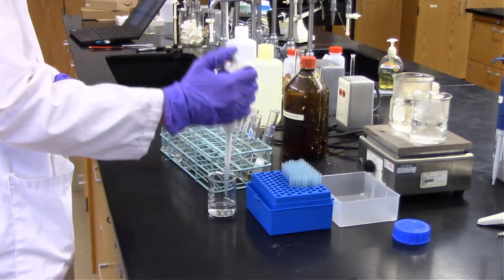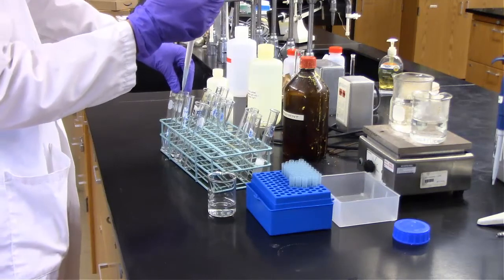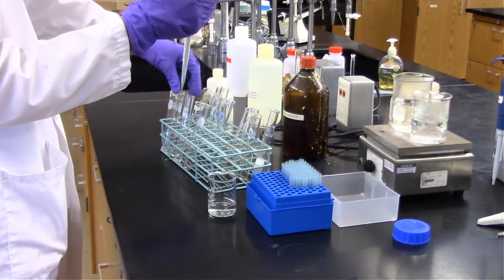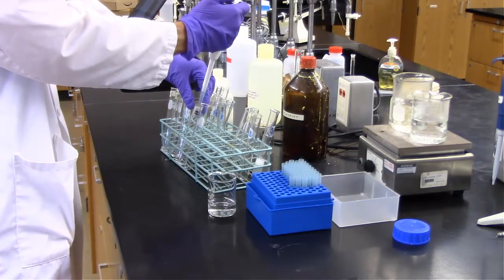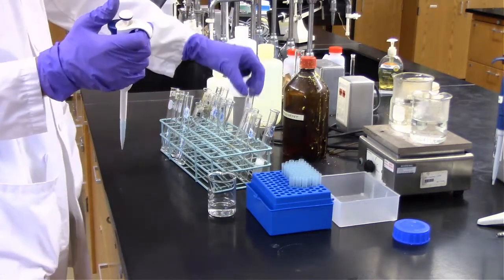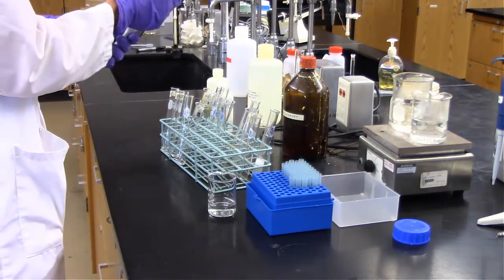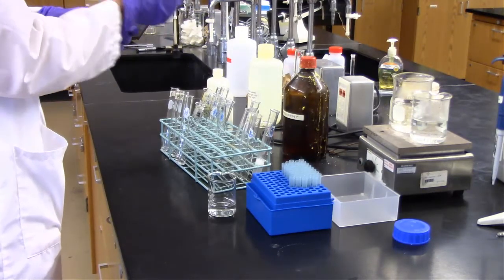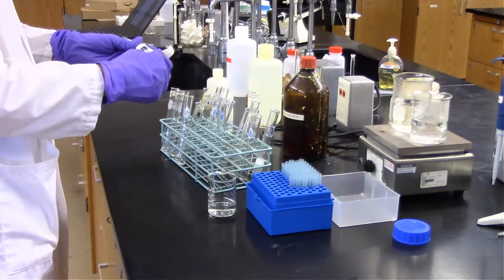And I cut out a little bit there of filling the last couple test tubes. Here I'm about to fill the 5th. I'm actually just counting here to make sure that I should be filling 5, because I had 6 on the rack, because I originally planned on 6 before I redid my calculations. So I took the last test tube out and I have 5 test tubes now where I need to add the appropriate volume of the maltose stock solution to each one.